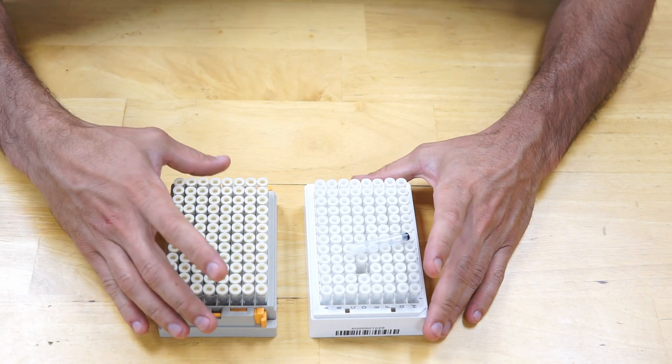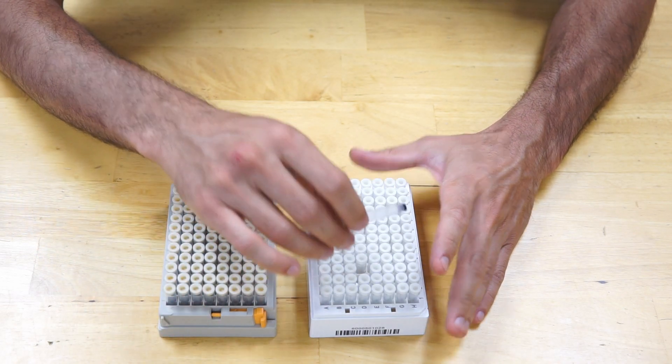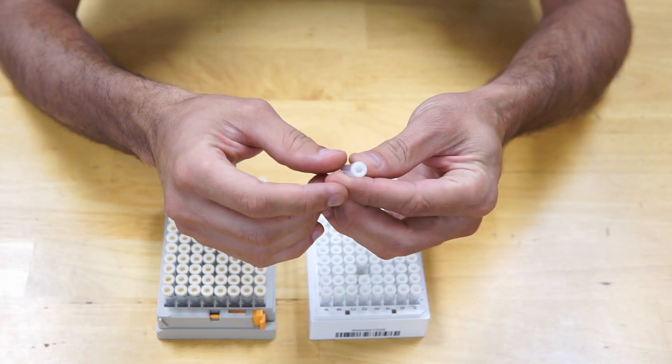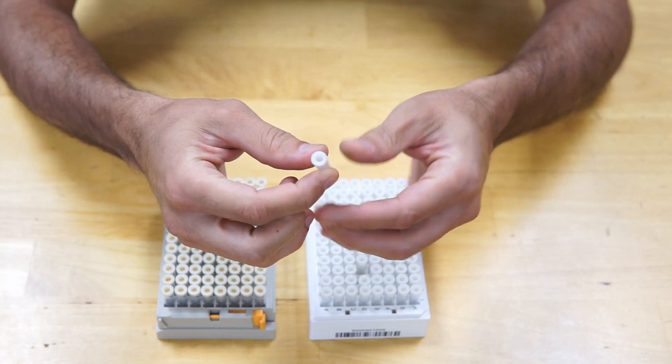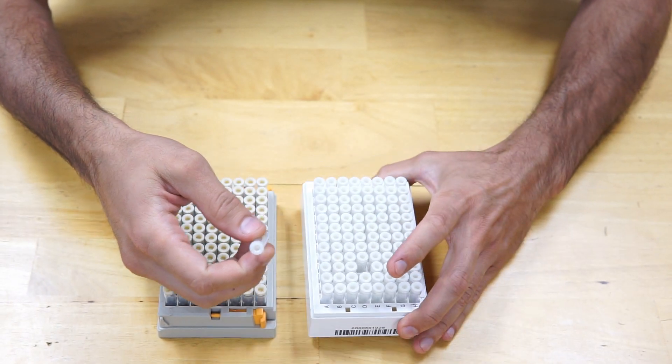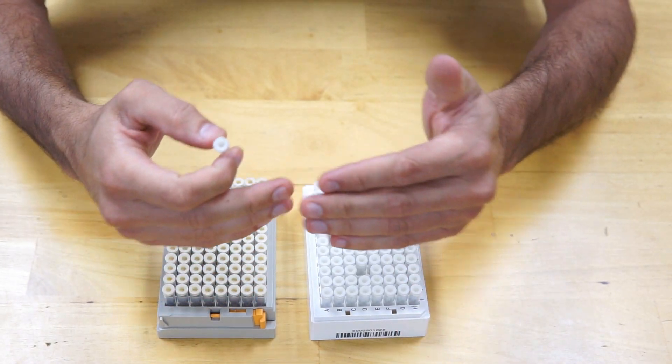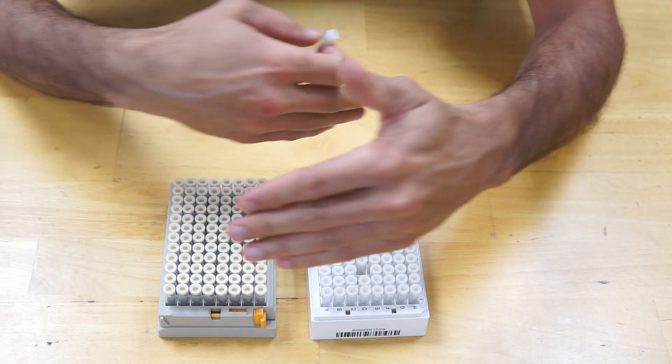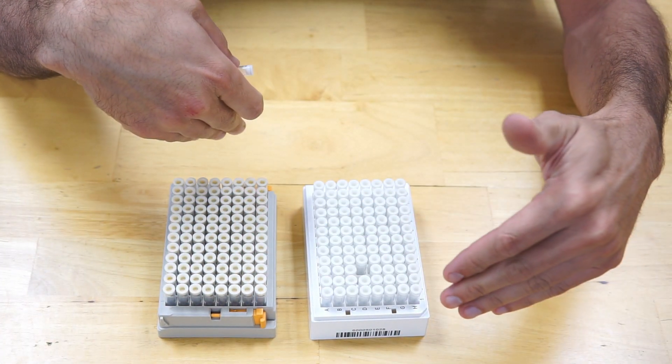The problem was to move small microtubes between different microplates on a desk. The desk dimensions were approximately 120 by 70 cm.